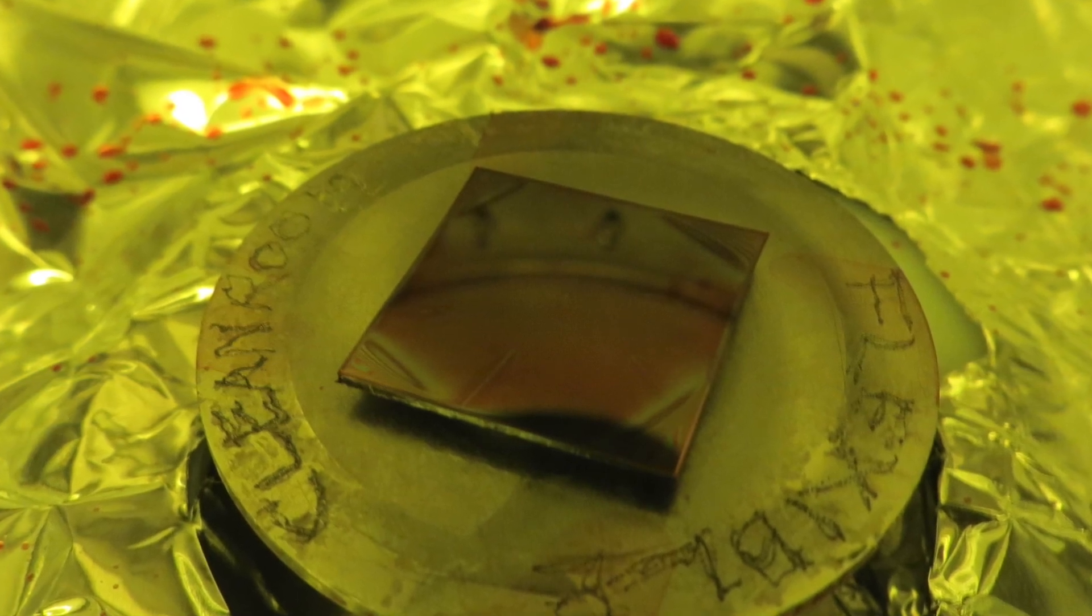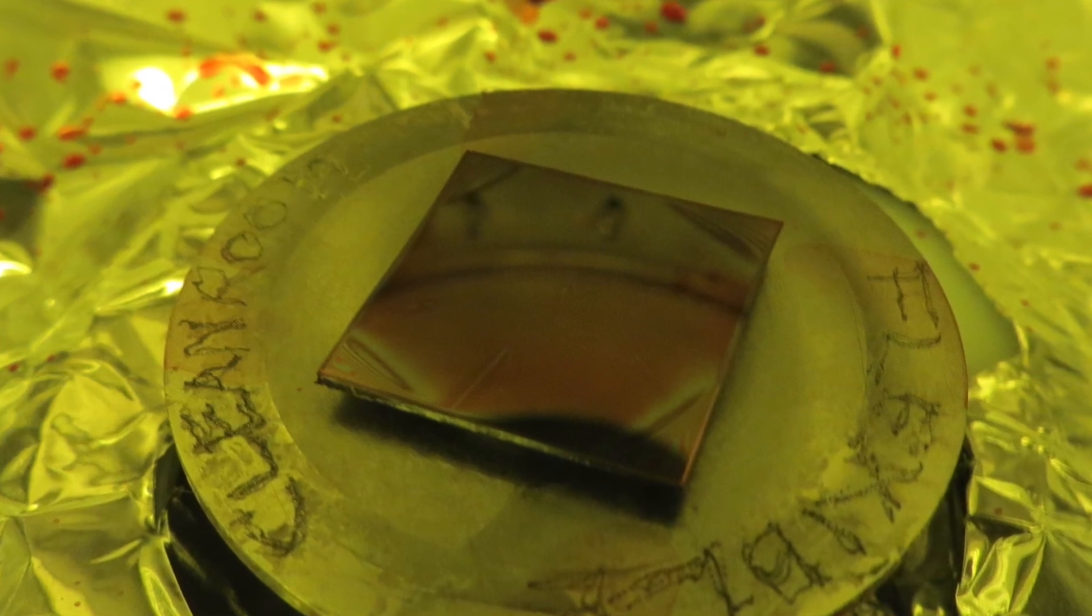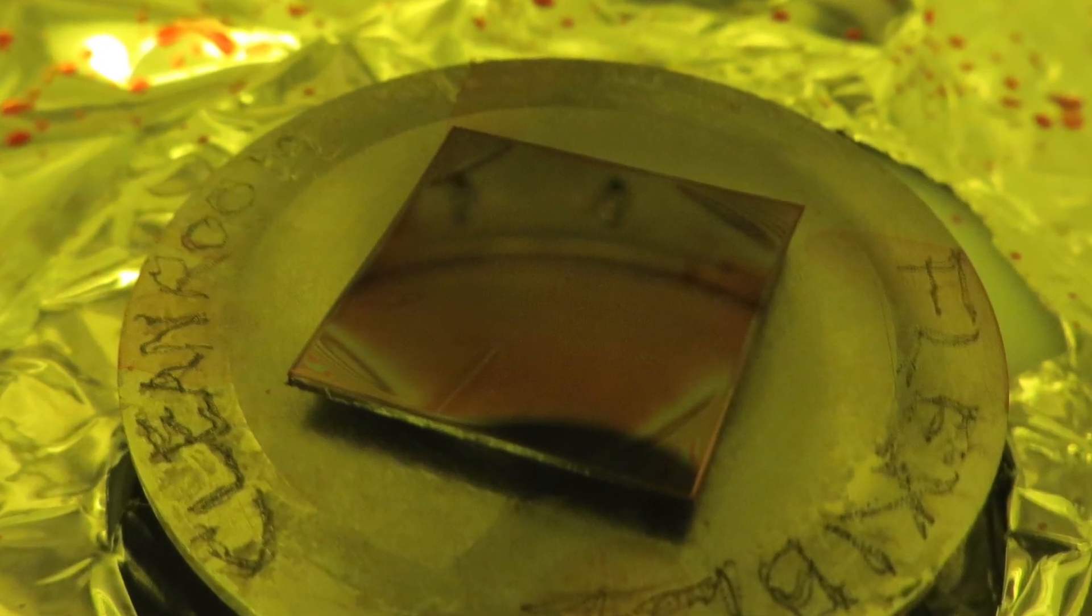Square-cornered substrates will always have some unevenness in the corners due to air turbulence during spinning. If you hit the spin button and the sample goes flying, it probably means you have the wrong size chuck.